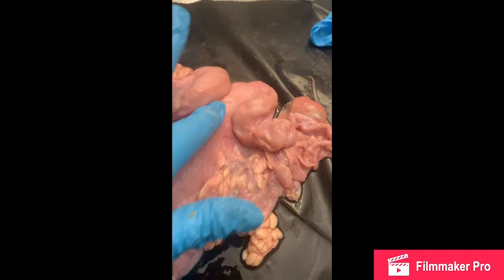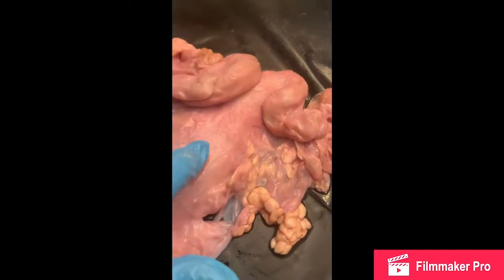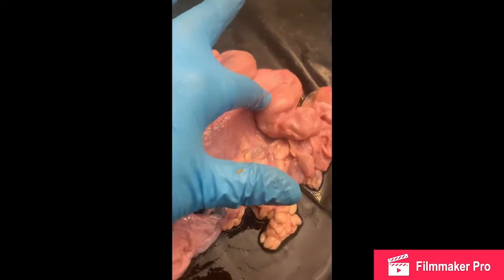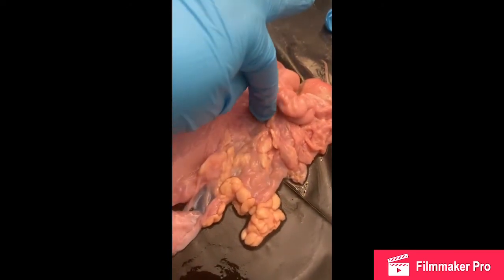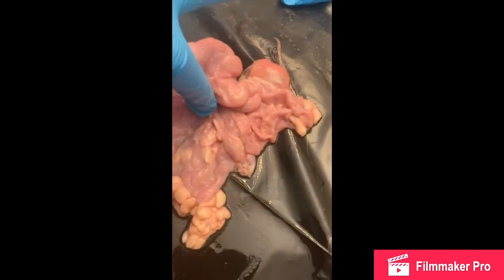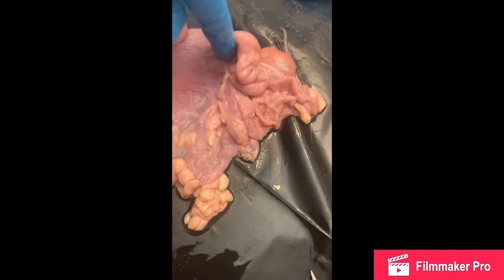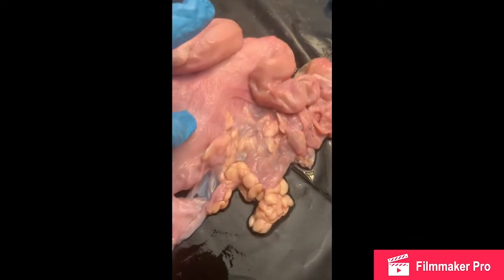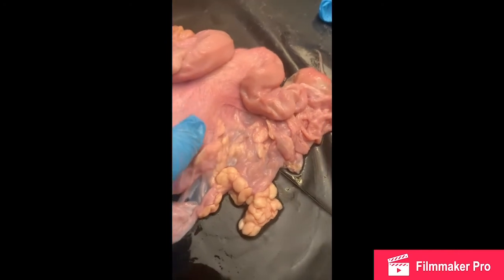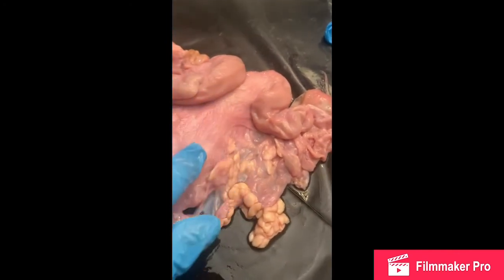And looking at our uterus right here, we can see that it does have a smooth texture, which is going to be our serosa, and then we have up to our uterine horn, where it does connect to our oviduct here. You can see connecting up here to that uterine horn, and then down to our uterus right here, where I am touching with my finger, which has a smooth texture.